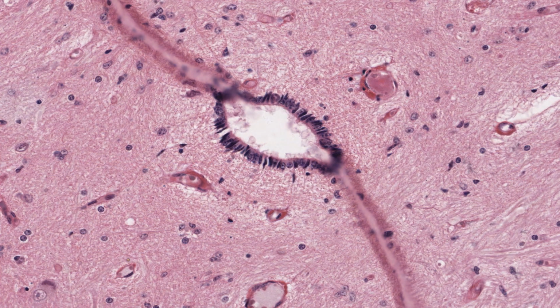They are joined at the apical borders by typical junctional complexes you see in other epithelia, but there is no basal lamina supporting them. Look carefully here and here and note that the basal ends of the ependymal cells are elongated and extend and apparently branch into the nearby neuropil.